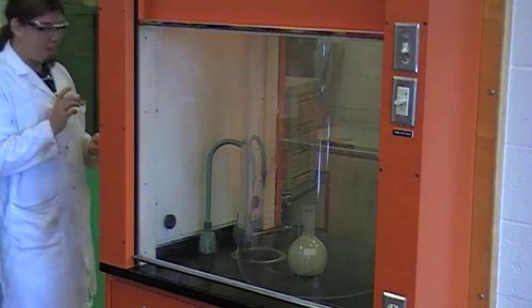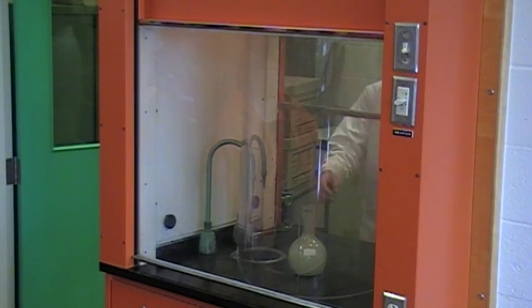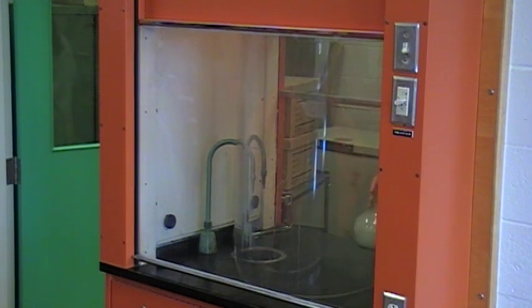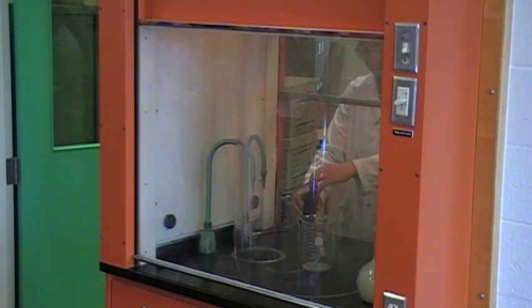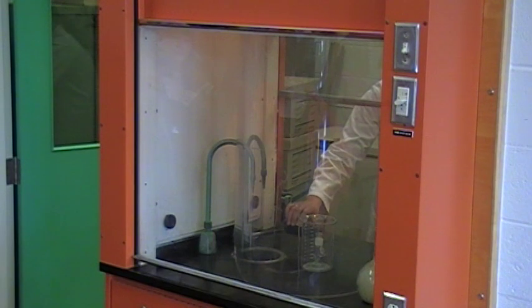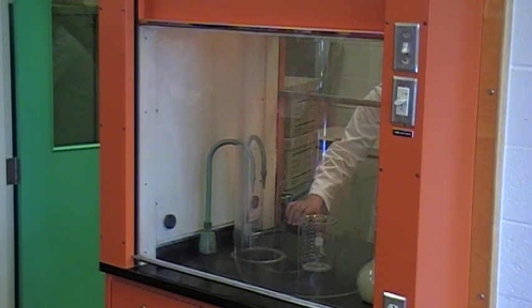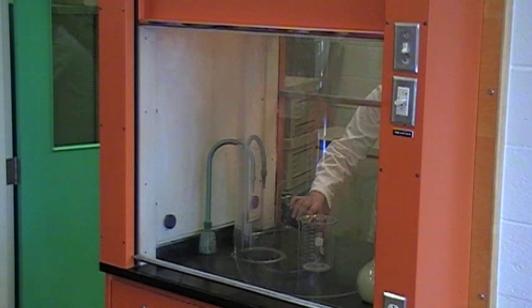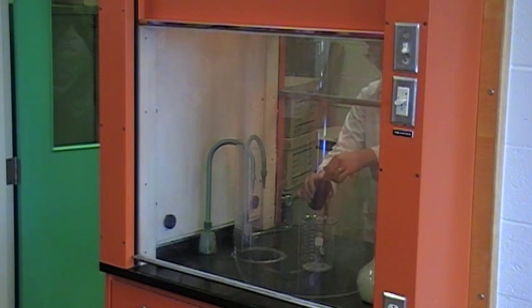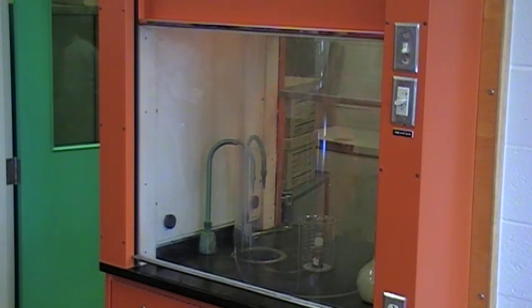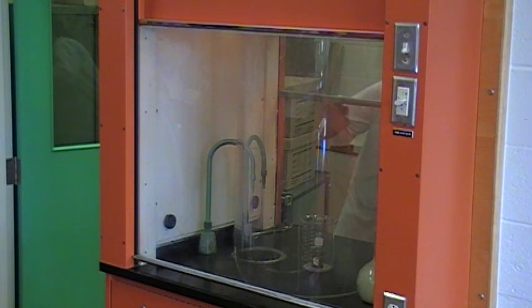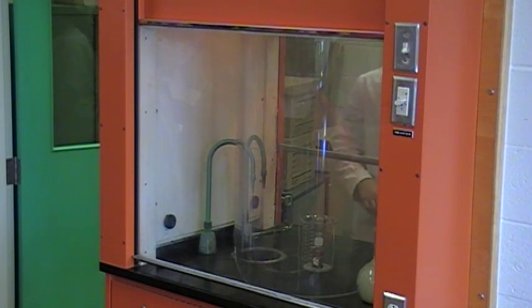I've got a different setup for this one, which has explosions in mind. Because this one will be an explosion. I have a little bit of liquid bromine in my small beaker, just enough to cover the bottom. So you'll see the gases are coming out now, and that's the liquid. Bromine is very unpleasant stuff. It's one of the most reactive substances known to man.